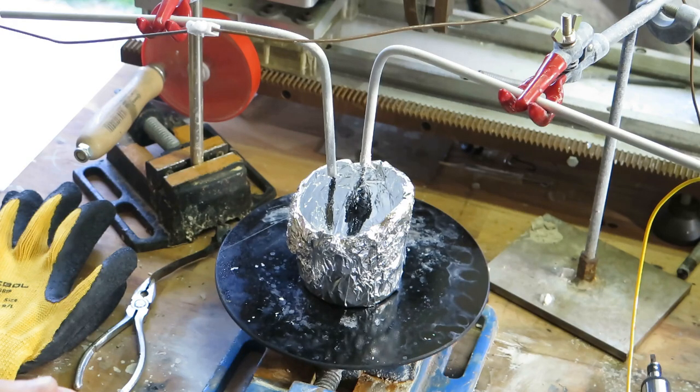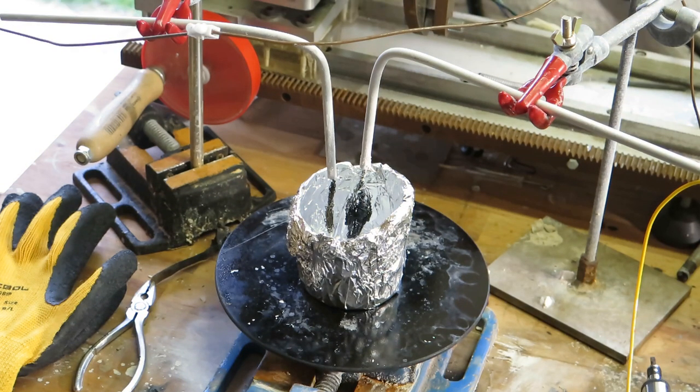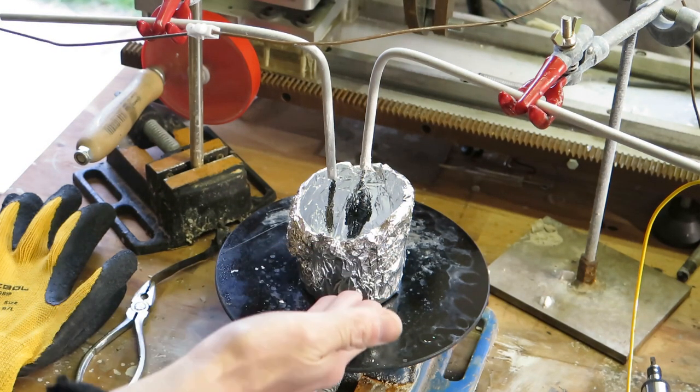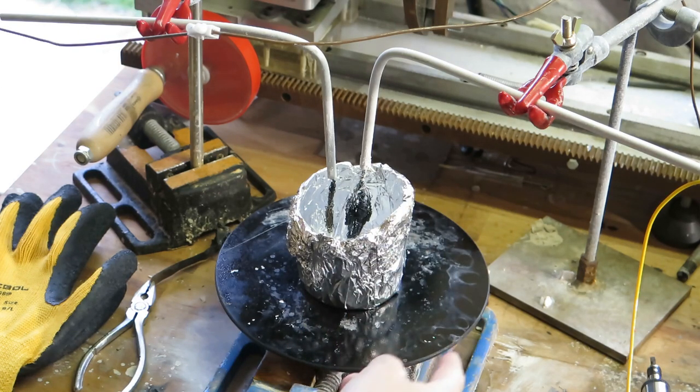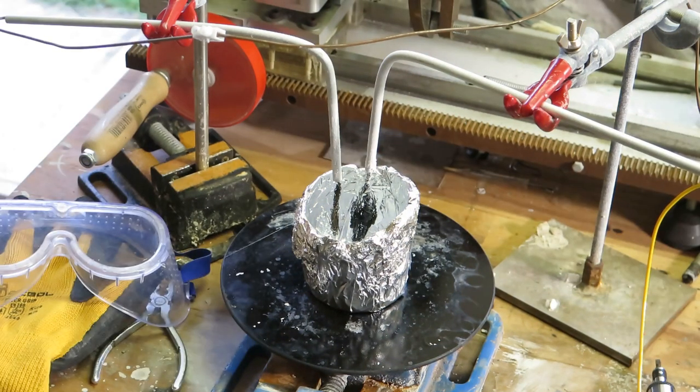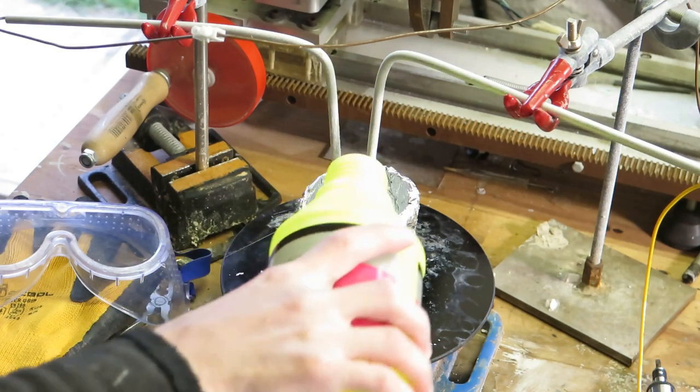And I'm waiting for some new wire for electrodes. It will be much better, but it comes from Germany, so that will take some time. Now, I'm going to do this in aluminium foil, and that is because I could do it in anything really, because I'm not going to melt whole sodium hydroxide, I'm just going to melt it locally, because it's much more convenient that way.